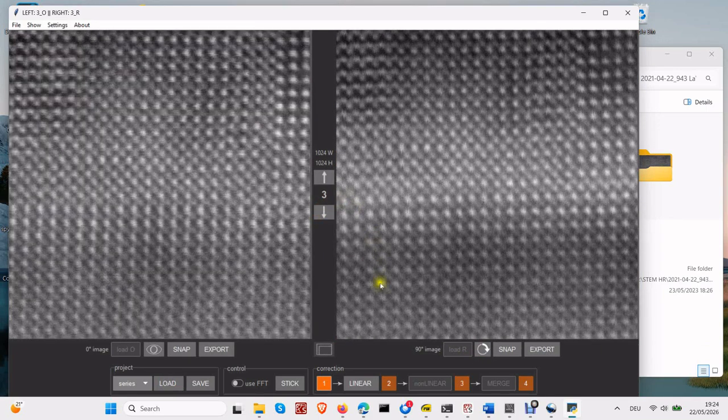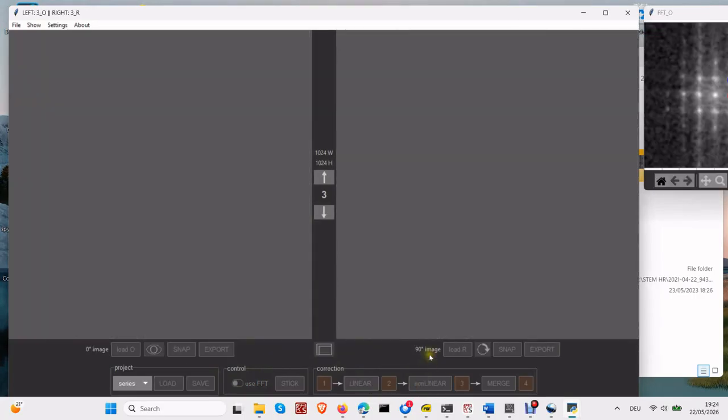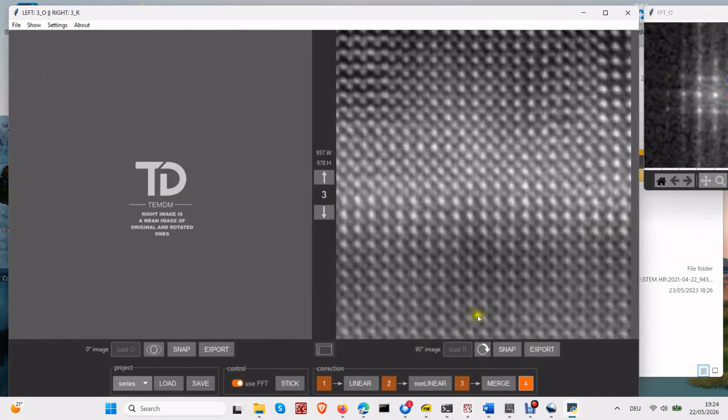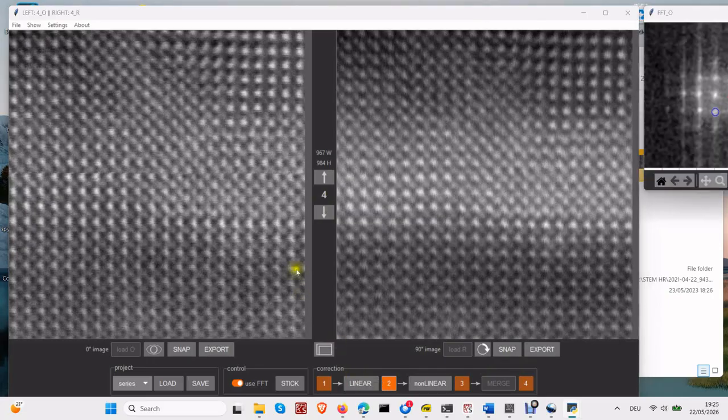Okay, then we can process each pair in exactly the same way as we did with an individual pair. Don't forget to activate the Use FFT switch. Proceed. Linear correction. Nonlinear correction. Merge. Then go to the next pair, and again, linear. You are not required to process every pair to completion. In many cases, you can immediately see that there are problems, either with scanning or with alignment.